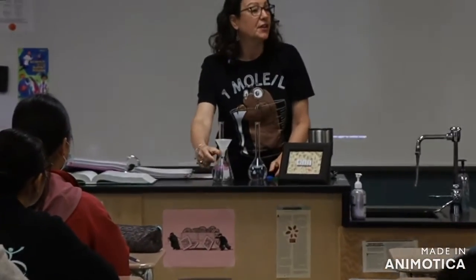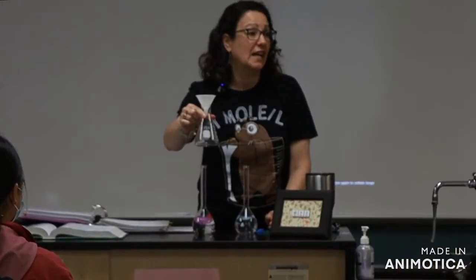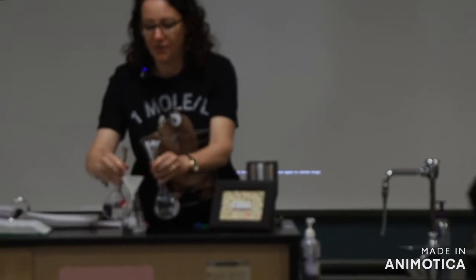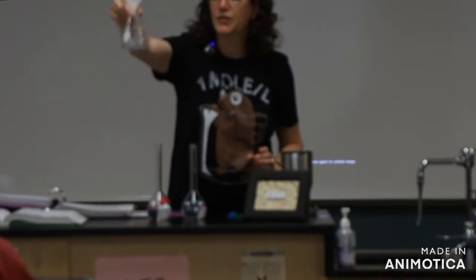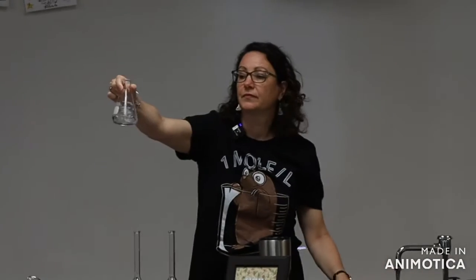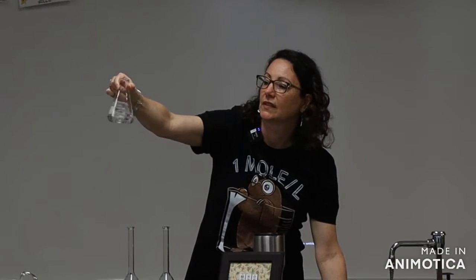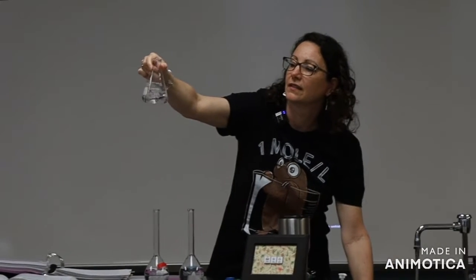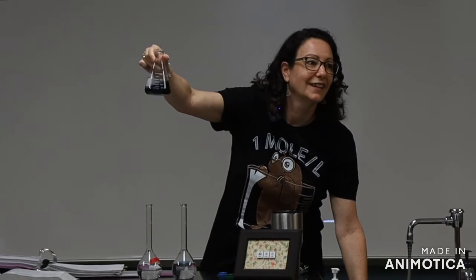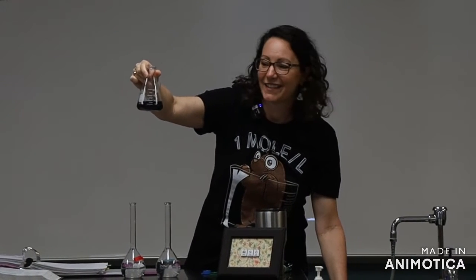So I'm going to mix them in here. You have to keep your eye on the flask the whole time. So watch the flask carefully. And okay, watch the flask. Are you watching? Oh. You see that?